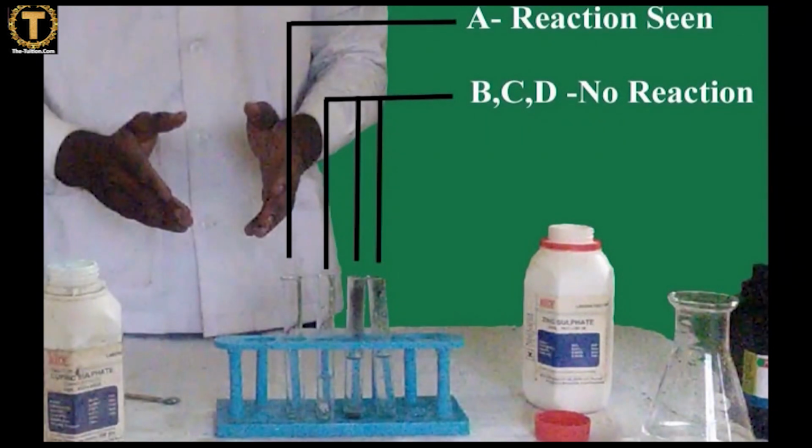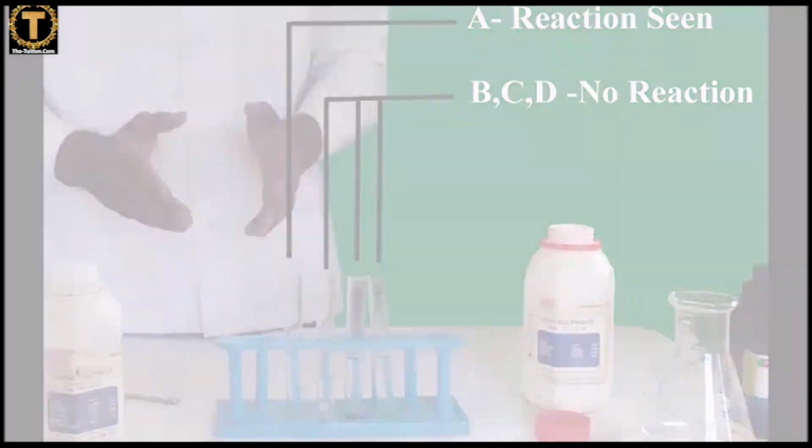In A, there is a reaction seen, but in all the others, B, C, and D, there's no change and there's no reaction taking place.